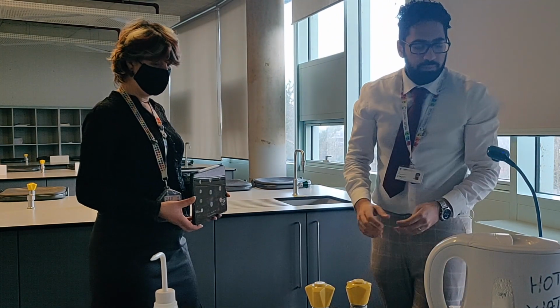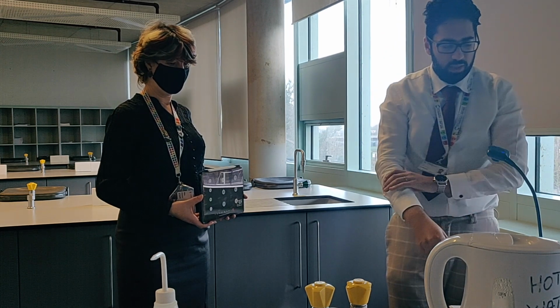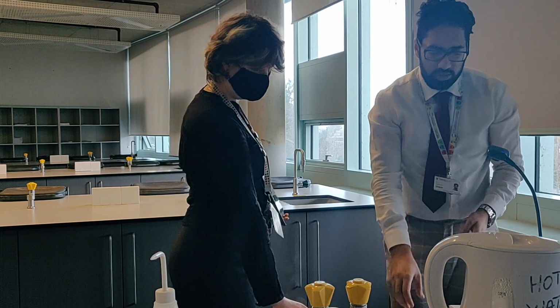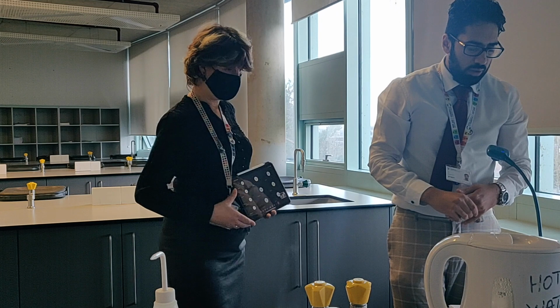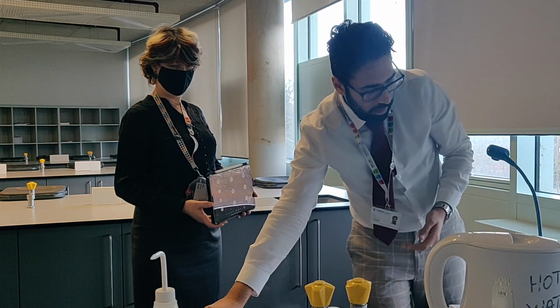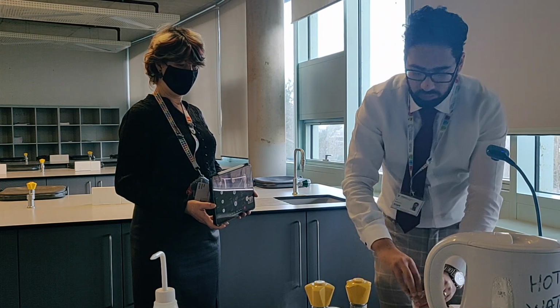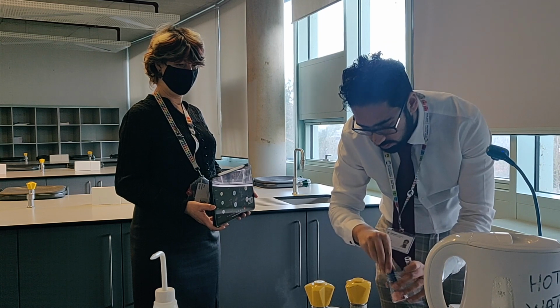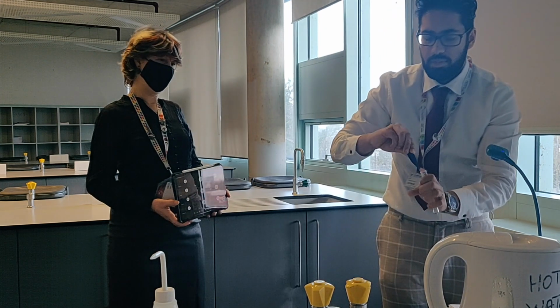Right, that was test 3. Now test 4 is testing for hydroxide ions in aqueous solution. Test 3 was testing for ammonium ions, and test 4 is testing for hydroxide ions. So we're going to take 1 centimetre cubed of 0.4 sodium hydroxide solution and put it in a test tube with red litmus paper, or universal indicator paper, a similar kind of thing. So there's my red litmus paper.